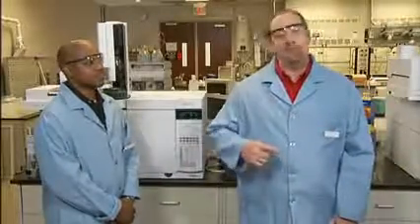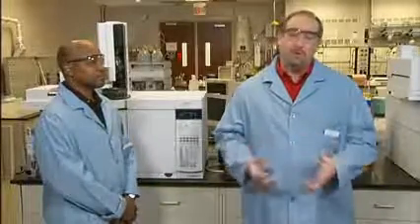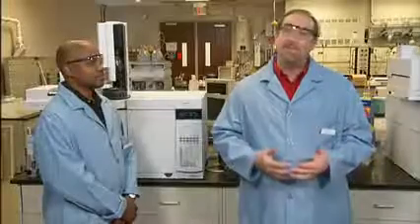The only real way to get them out is to bake out your column. You can take the column out and solvent rinse it, but most people aren't doing this because of the time required to do it. Typically, bake-out times are 1 to 2 hours. Longer times can be used, but based on the volume of the column and the flow rate of the gas during bake-out, you should be able to get most of the things that will come out within the first 2 hours of bake-out. So what now?